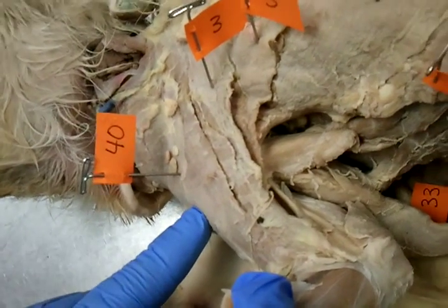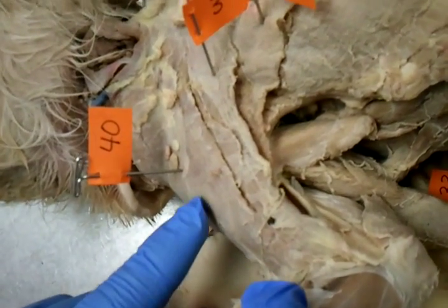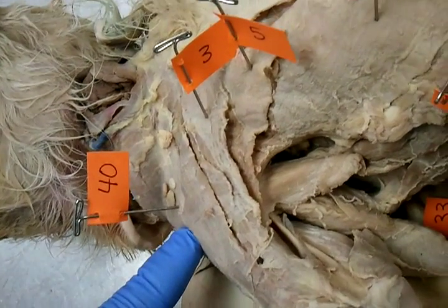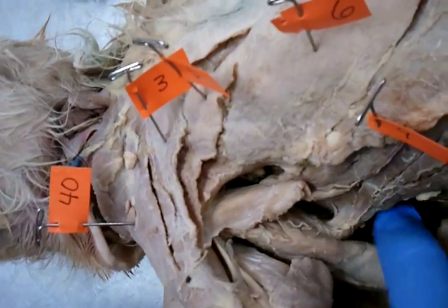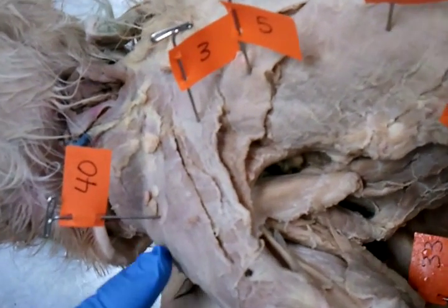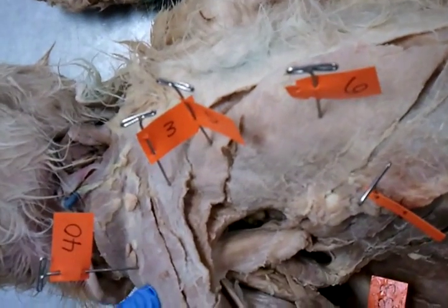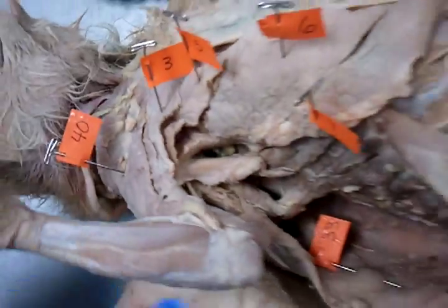Number forty is kind of the muscle of the shoulders — that is called clavo deltoid. It makes sense because it's where your clavicle meets your deltoid, so it's clavo deltoid.